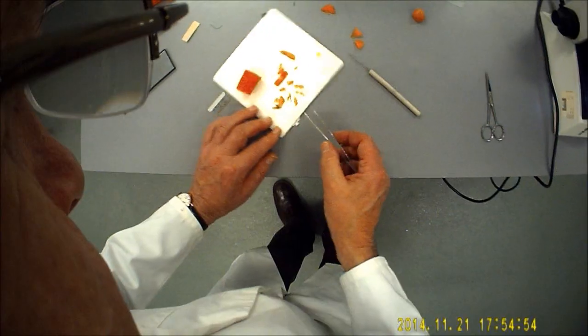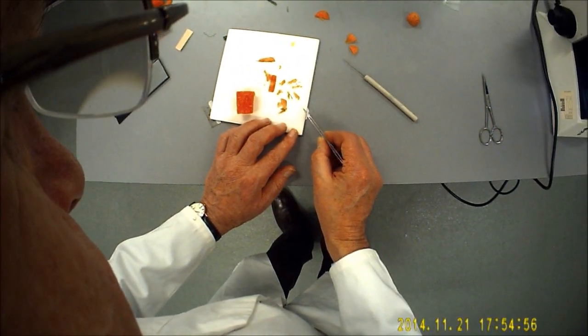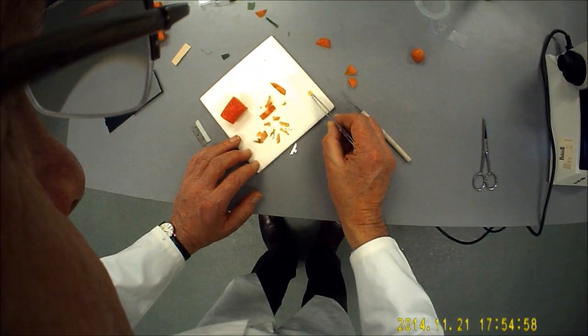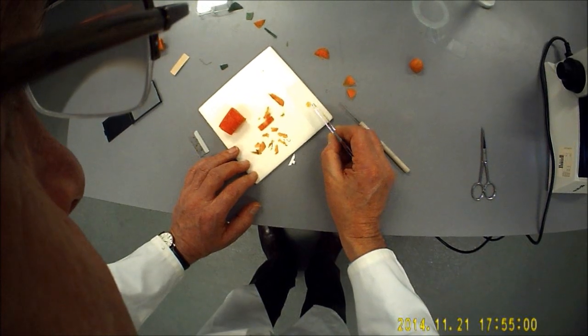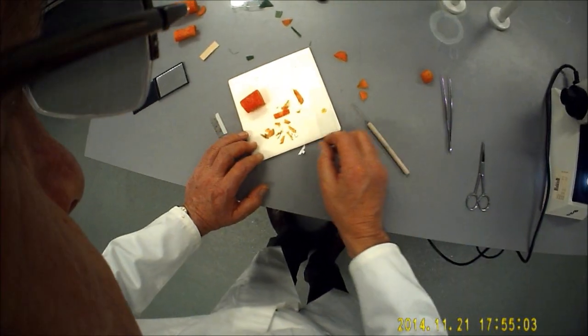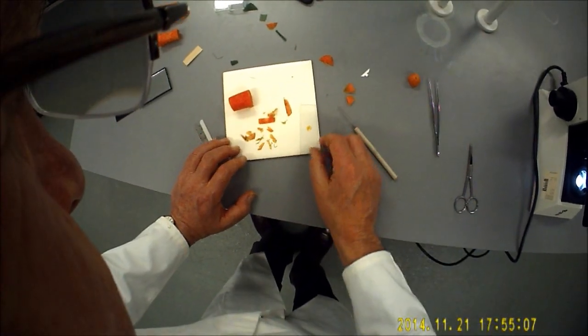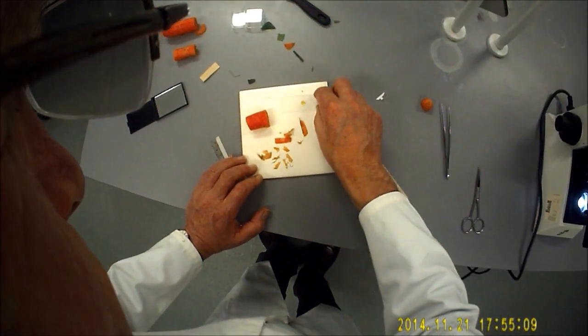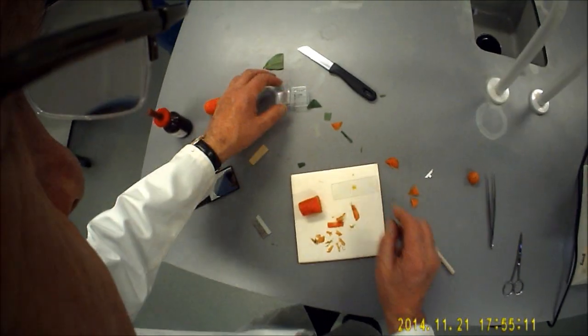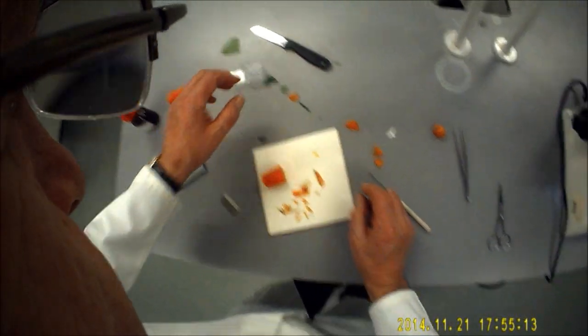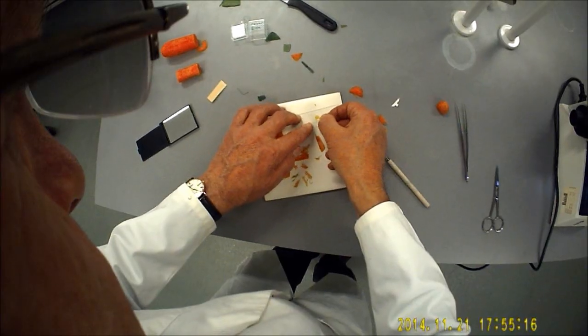I'm going to get these pointed-end tweezers and I'm going to pop my specimen in. Now you'll probably find that if you've cut your specimen thinly enough, it will automatically arrange itself the right way up. If not, it's back to the drawing board. Pop a cover slip over the top.